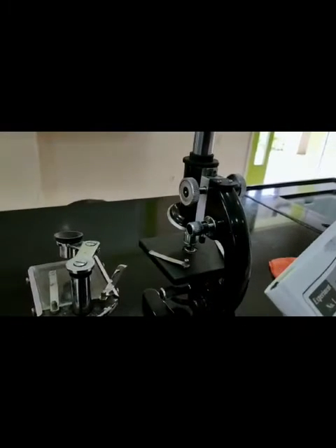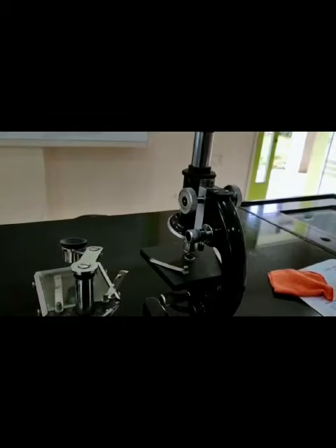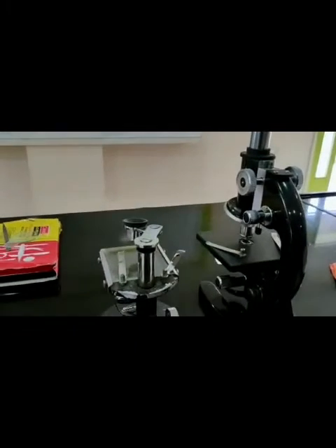Good morning children. Today we are going to start with the very first experiment from the 11th standard biology practical.